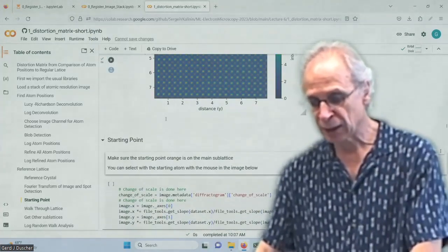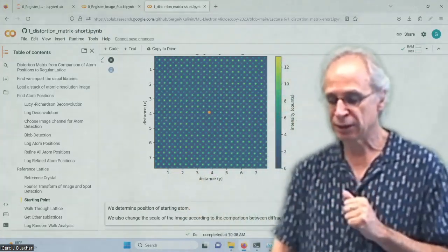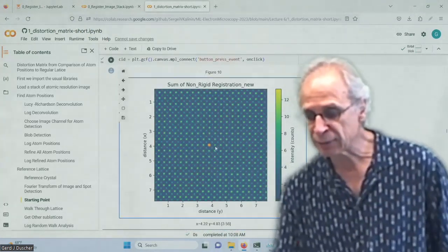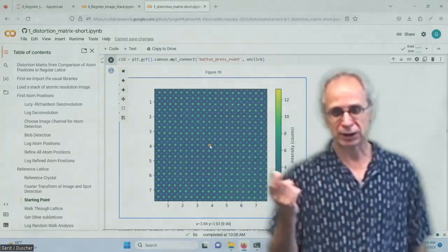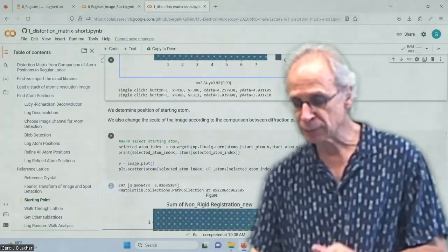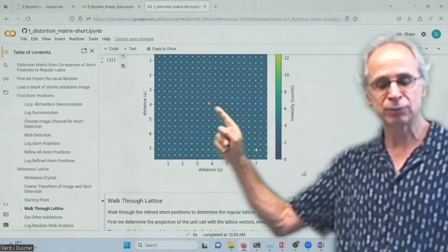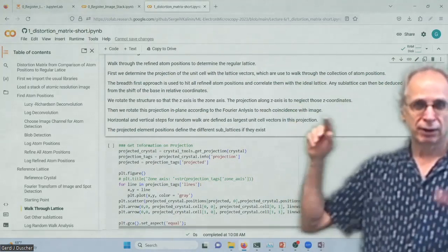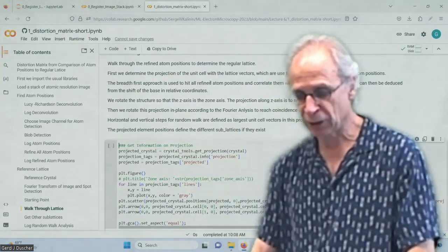And what we want to do is run through that with, I sort of had an image of them. And I have to select one. If you don't select one, the program doesn't work. So you have to select one. And then it tells you which one you have selected, just to make sure. And now we walk through the atom positions that we found with the unit cell.